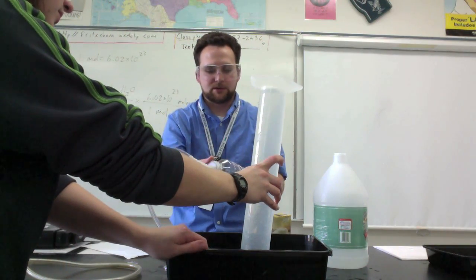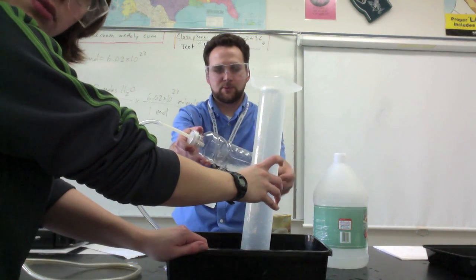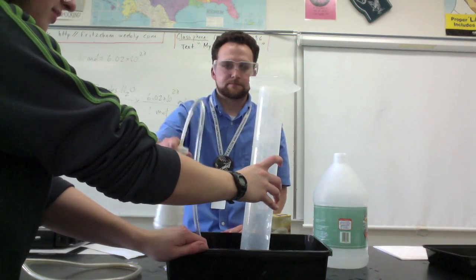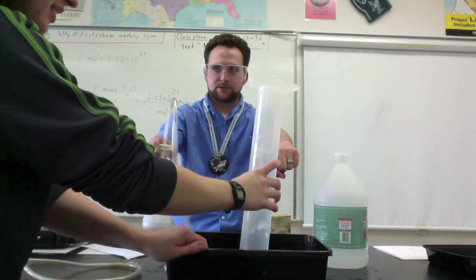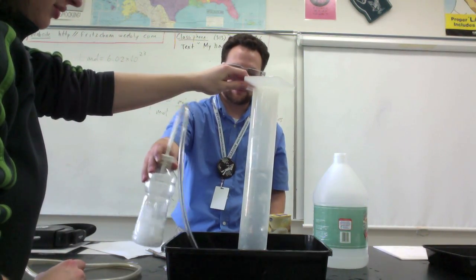So now I'm going to shake this and get my baking soda to actually tip over and react with vinegar, and we're going to produce some gas in here and be able to measure it. So that's what I'll do right now. So you can see all the bubbles going in there, that's all carbon dioxide gas being produced from this reaction.